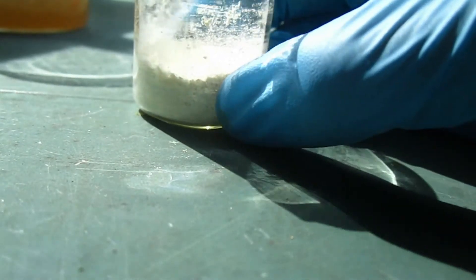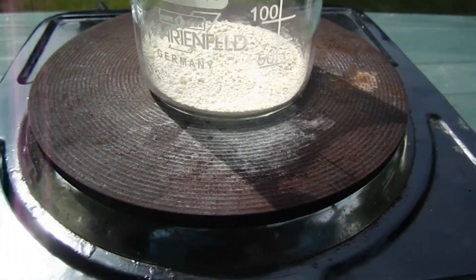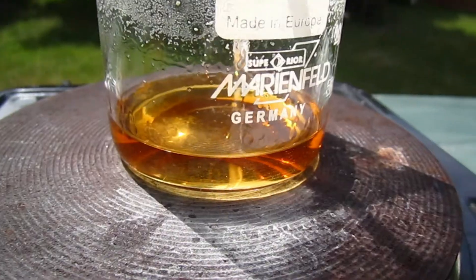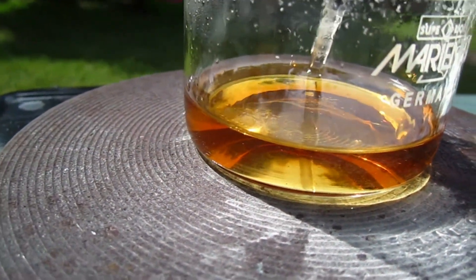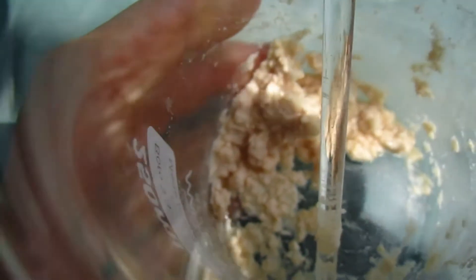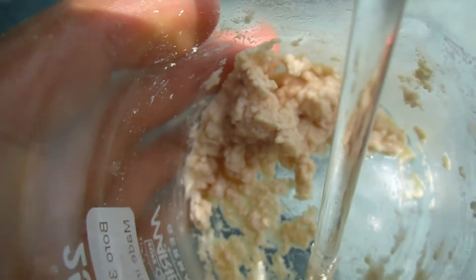So now that the m-chlorobenzoic acid is dried, I'm going to recrystallize it from a water-ethanol mixture. That's how it looks after recrystallization. I just have to filter it and I'm going to be done with it, unless I want to do a second recrystallization from petroleum ether.